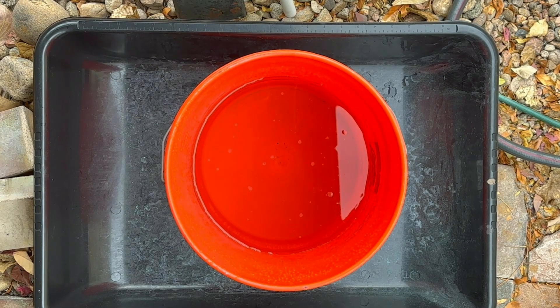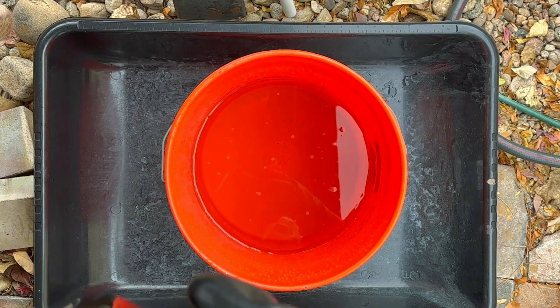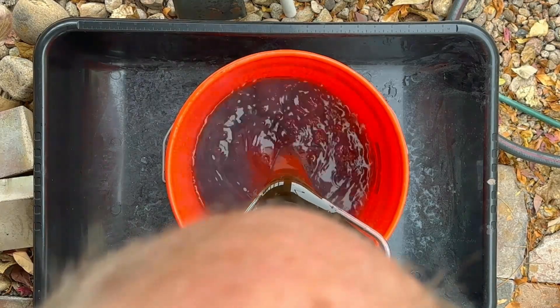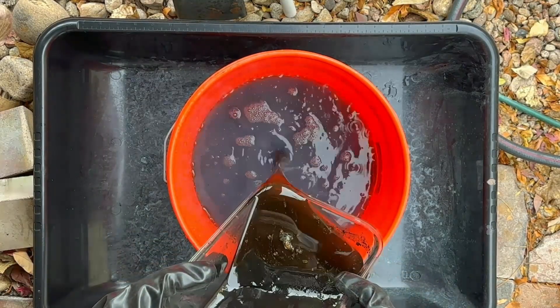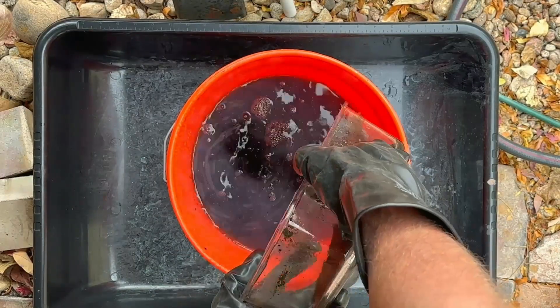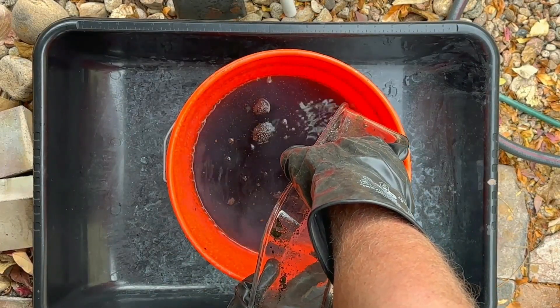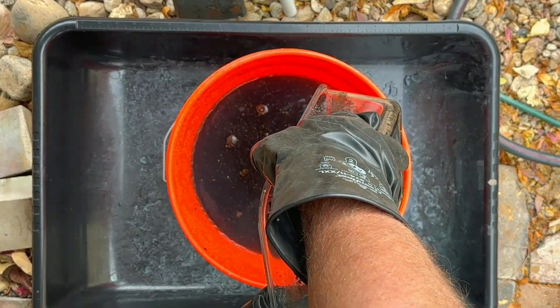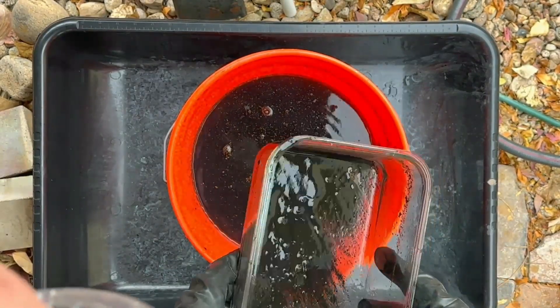The cell is comprised of gold sludge and concentrated sulfuric acid. We're going to dilute that by carefully pouring the acid into about ten times the amount of cold water, and then we'll rinse all of the gold sludge in there, give it a good stir, and then work on the other two containers.